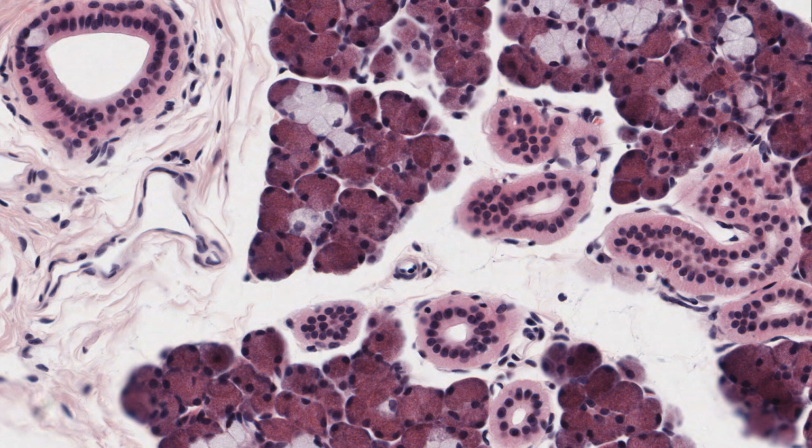If the epithelium is only one cell layer thick, and use the nuclei as your guide, it's called a simple epithelium. So here are examples of a simple epithelium. Don't get confused by areas where the tube has been sectioned obliquely. Concentrate on areas where the tube has been sectioned transversely or perpendicular to the epithelial surface.